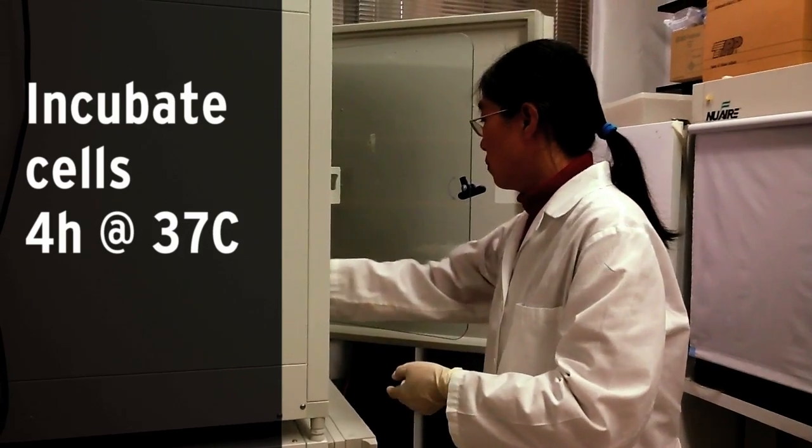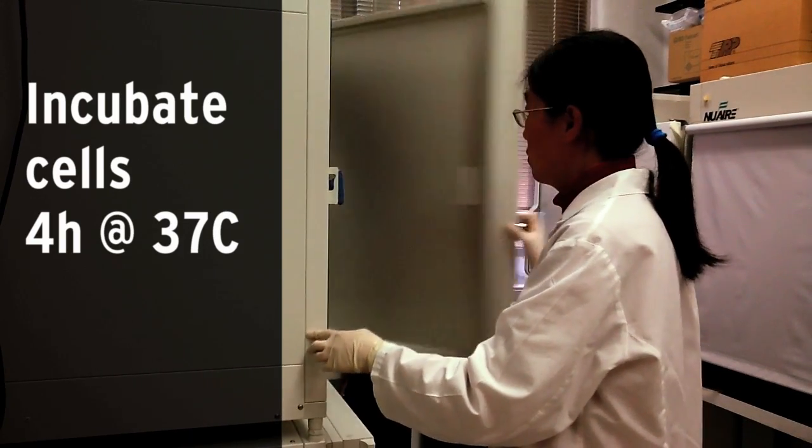Cells are then incubated for 4 hours in humidified 5% CO2 at 37 degrees.